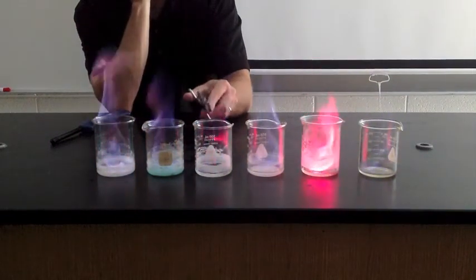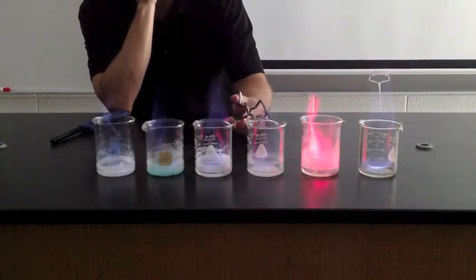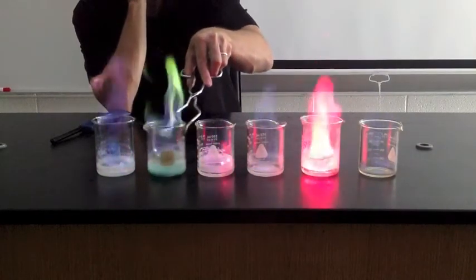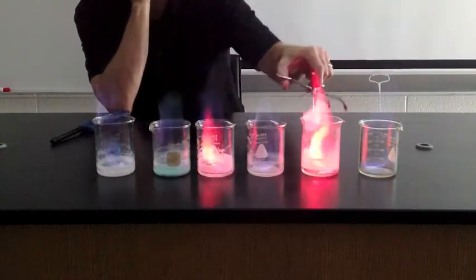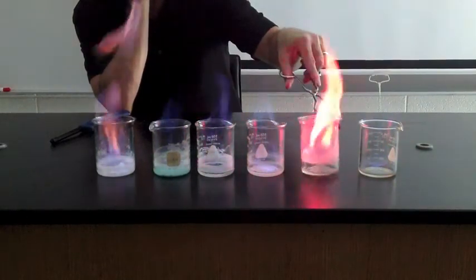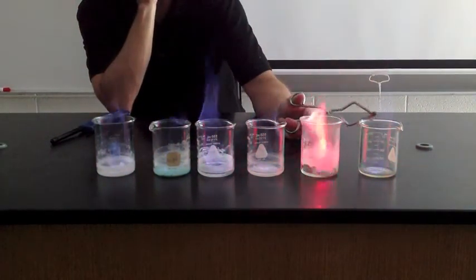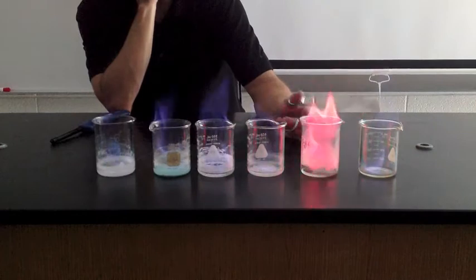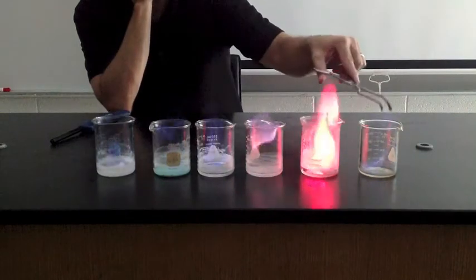These are colors that would help you identify certain metals in an unknown compound. So if you see something that burns green, like this copper flame here, that would be a good indication that there's some sort of copper in there. Or the lithium flame, this pink flame, that would be definitely an indicator that you have some sort of lithium in there. Okay? The methanol, as you can see, burns just a very faint blue. So we know that the chemicals in the beakers are causing the color of the flame. So this will be considered our control.